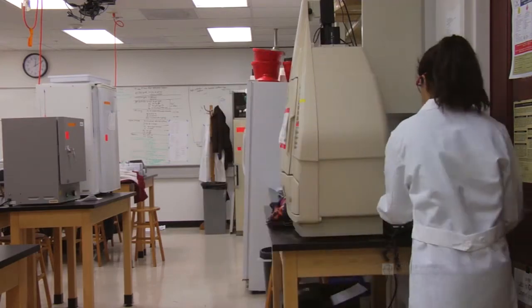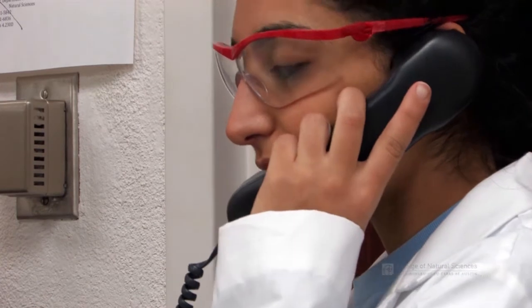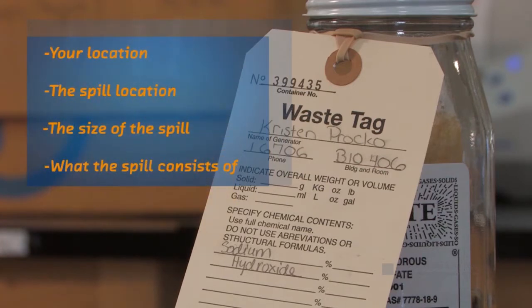Report the situation. Once you're away from the danger, report the spill immediately to UTPD and EHS. Inform them of your location, the spill location, approximately how large the spill is, and what the spill consists of.